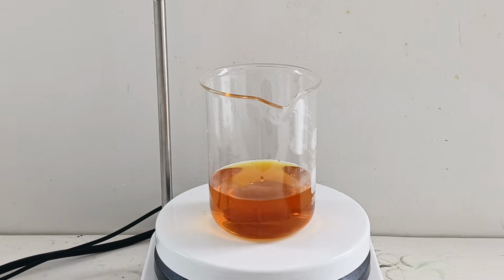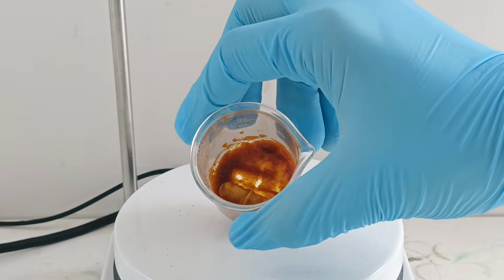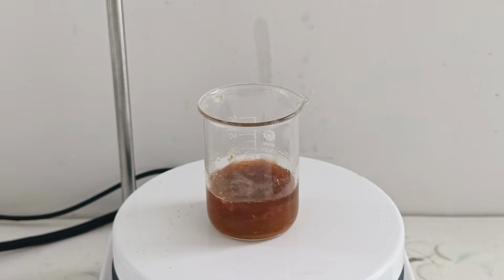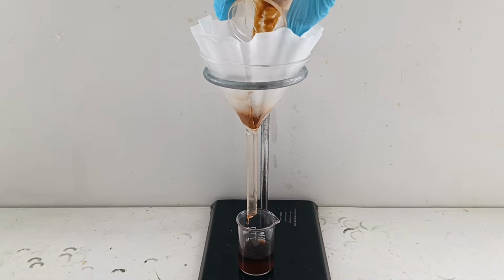Now, the only impurity present is all the sodium chloride salt formed in the reaction. This is easy to separate, and the first thing to do is heat up the solution and boil off all the water. Resorcinol is not very volatile and remains as a solid in the beaker, mixed up with the salt. Once I'm left with a dry solid, I add 20 ml of isopropanol and heat it up to a boil. The alcohol selectively dissolves the resorcinol while leaving the salt undissolved. The solution is then filtered to remove the sodium chloride.